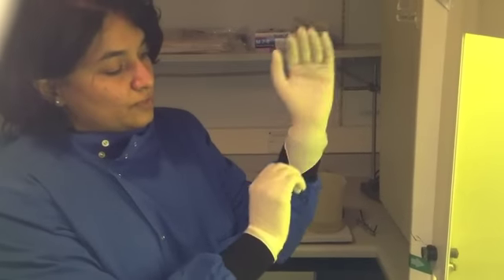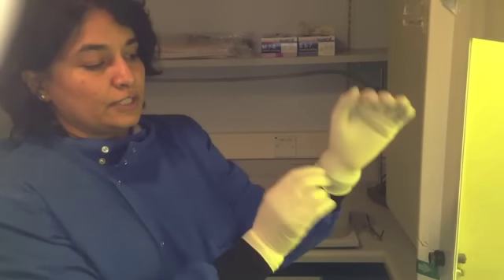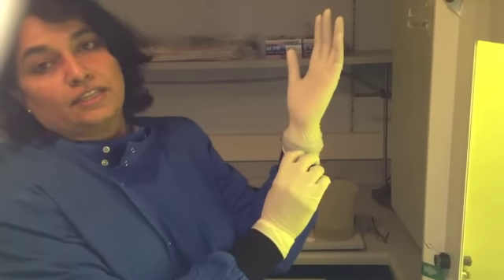Starting off with these gloves, what you need to do is make sure that your cuffs are well below and the gloves extend over these cuffs. That's the first point.